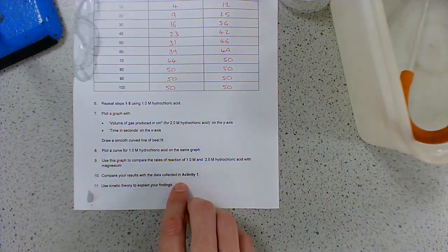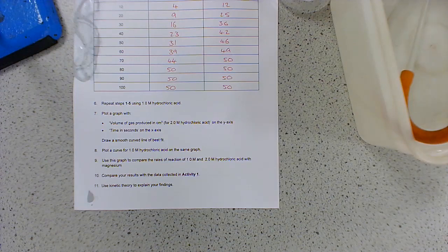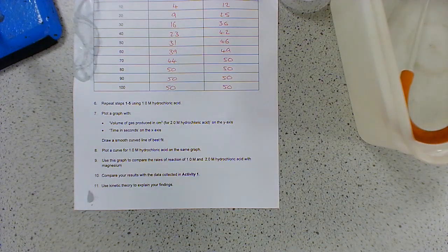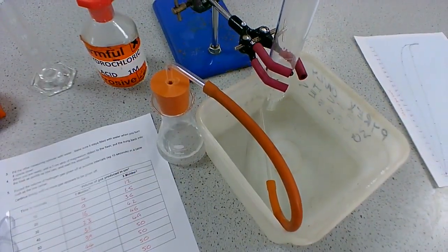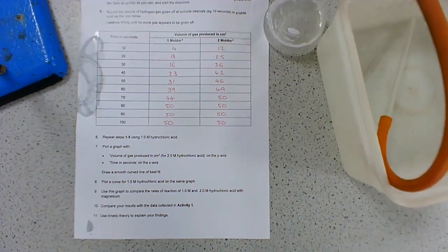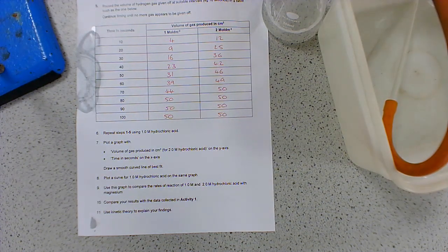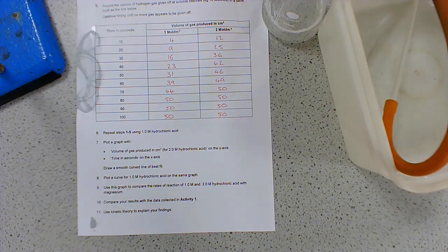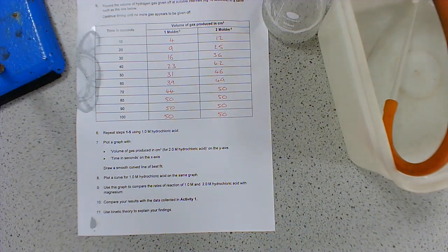What you also need to do is compare your results with the data collected in activity one - the disappearing cross reaction. Both activities vary the concentration, so look at the results for both and ask: what does that tell you? When we increase the concentration, what is that doing to the rate of reaction, and how do we know that from our results? Because we're not directly measuring rate - there we're measuring volume of gas, and in activity one we were measuring time taken. Neither of those things is rate. So how do we determine rate, and how do we explain the rate change using collision theory?